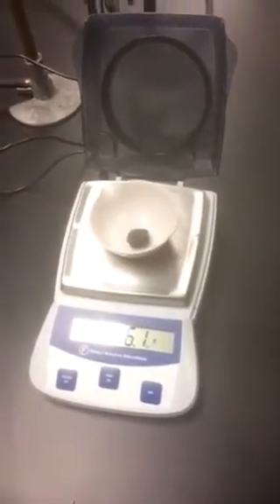Now for part 4, we're going to use an evaporating dish with another piece of steel wool. This time we're going to burn it and see what happens to mass when matter gets heated. Let me correct myself, we're not burning it, we're going to heat it in the fire. Here's the initial mass of the entire system. Please record 36.1 grams.